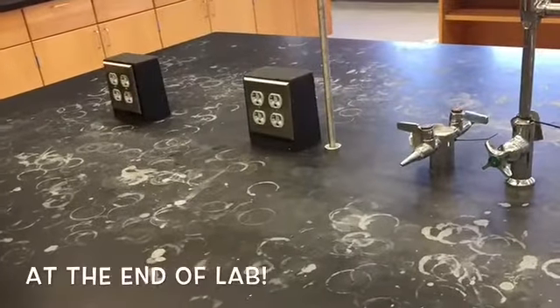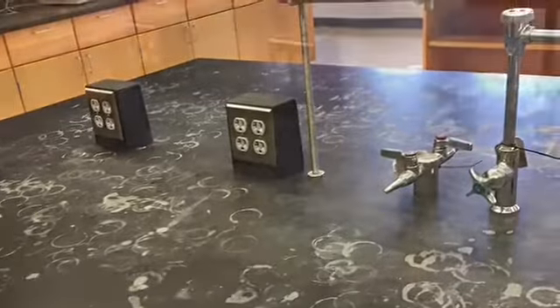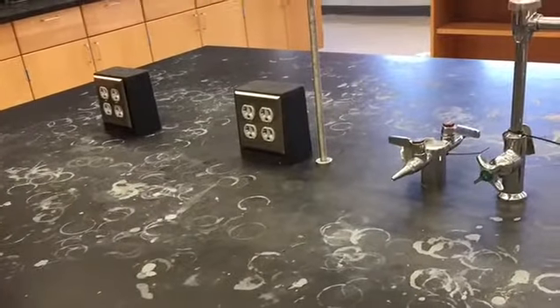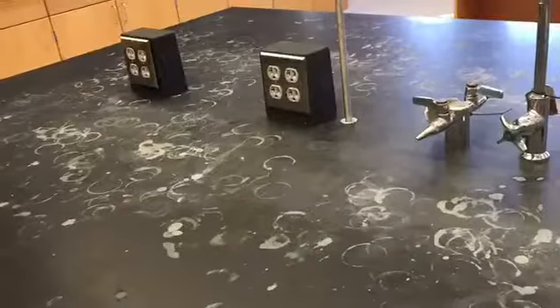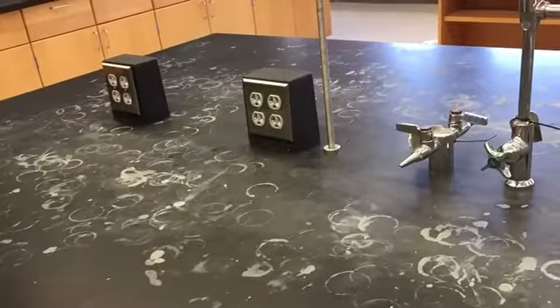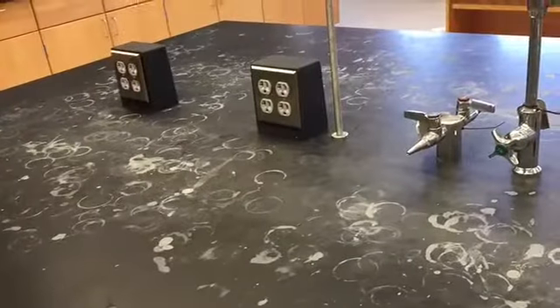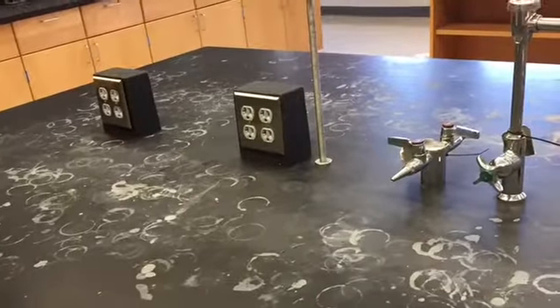Not only in just today's lab, but every lab, make sure to wear proper laboratory attire and to make sure that after you finish all of your experiments, your laboratory space is to be properly cleaned and all excess reagent is to be properly disposed of.